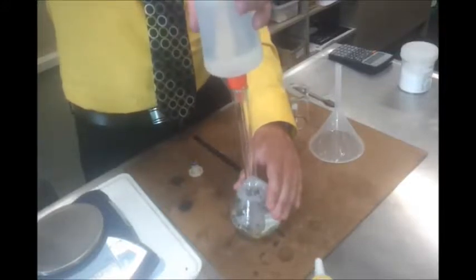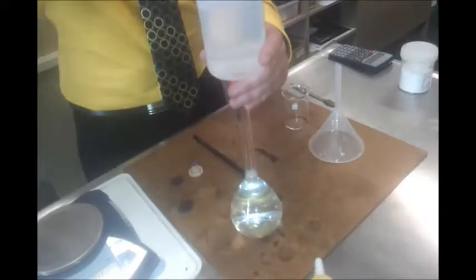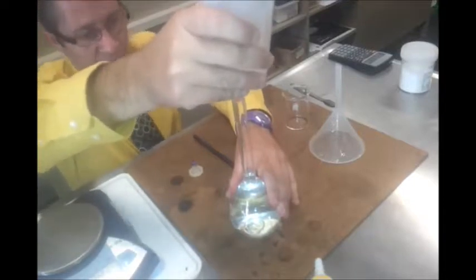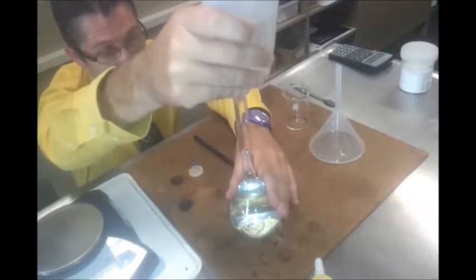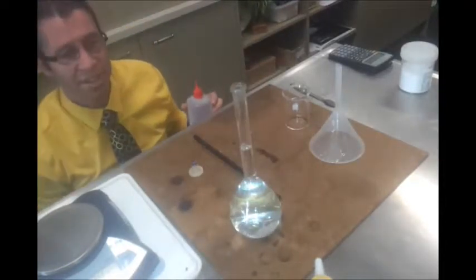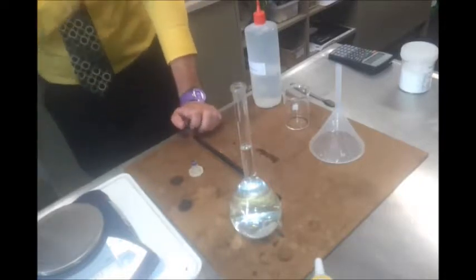And it's time consuming, as you can see. Okay, now's when we go slowly. I'm going to get my head level with the line, and I'm going to very slowly pour the liquid in, and I'm going to anticipate that it's about to hit the line. So there's that last drop that came out. So I anticipate. If you're worried about that, get a dropper and just use a dropper for the last little bit. If it goes over the line by more than about 1 millimetre, you've gone too far.